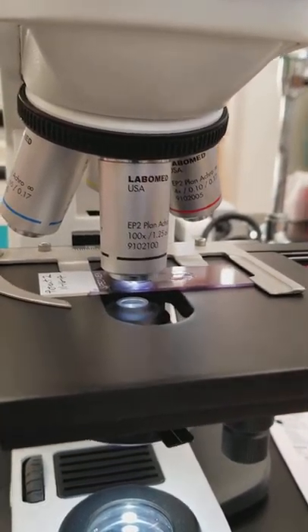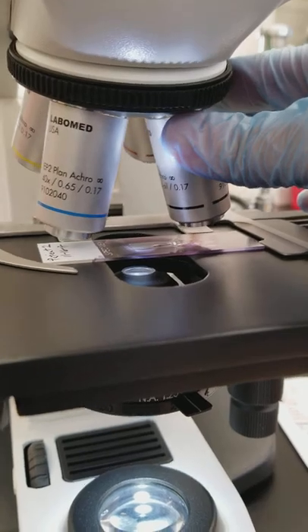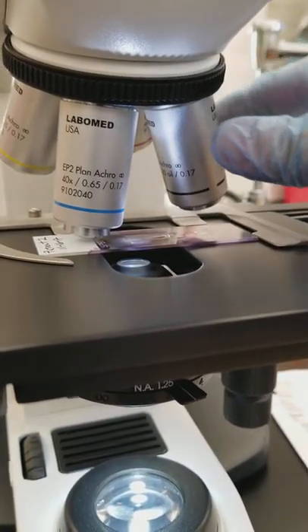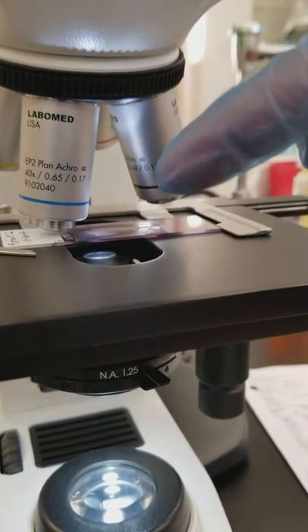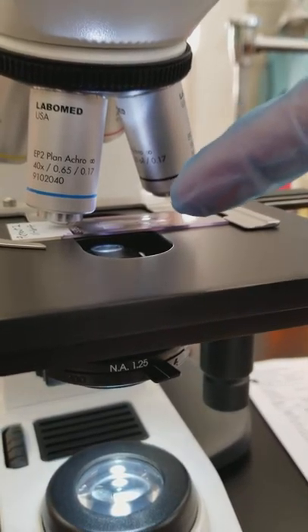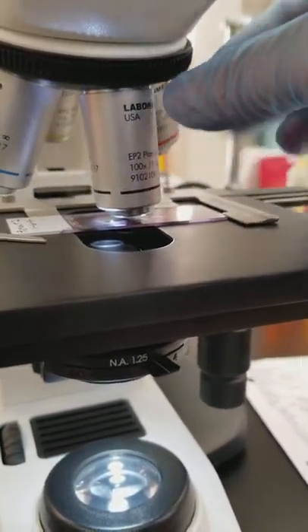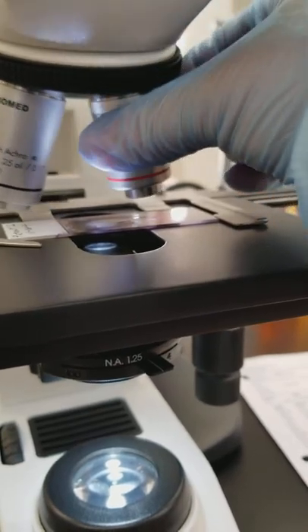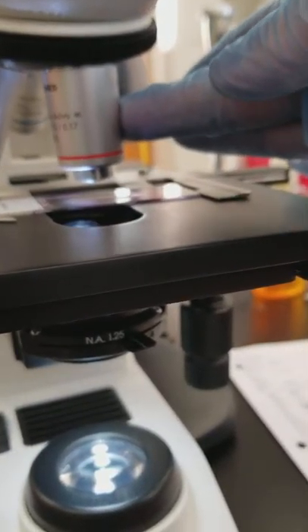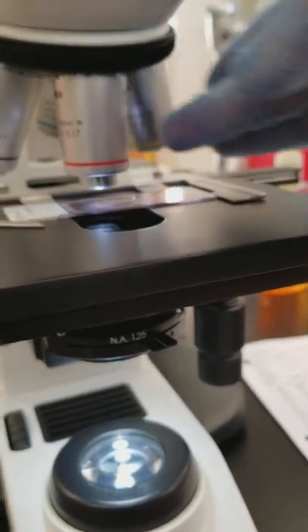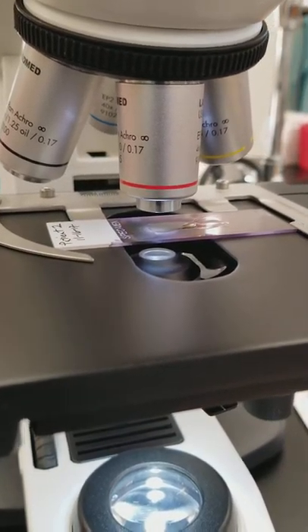If I move it this way, uh-oh, the 40 is going to get in the oil. That's what students do a lot and we need you not to do that. We need you to turn it the other way.